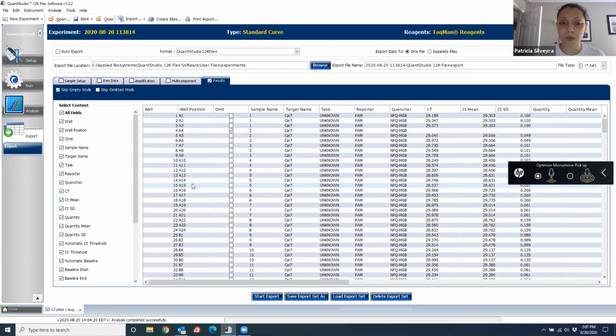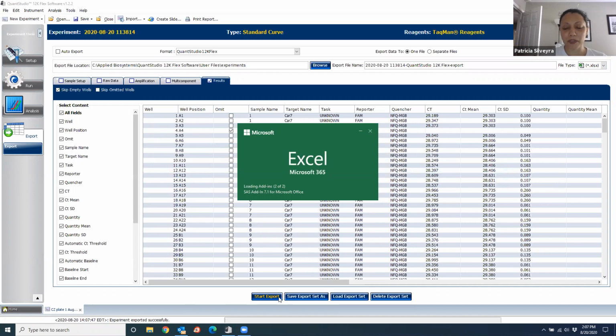So once you have selected what you want to export, you select how you want to export it. And here are several options. You can select to do it in Excel, or you can select to do it as a text file. Unfortunately, the machine that is there in the core facility probably will not let you do the Excel because there's no Excel in the computer. So either or is fine. You just export it as a text if you want, and then you import it from Excel, or try to export it as an Excel file. Either format, you just click on Start Export, and then it just exports it for you. So in this case, it's going to open it as Excel, but I'll show you how it looks when you export it as a text.